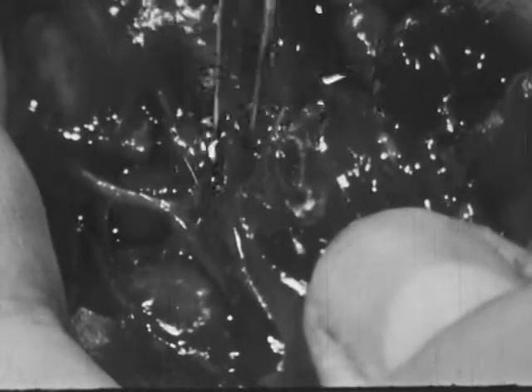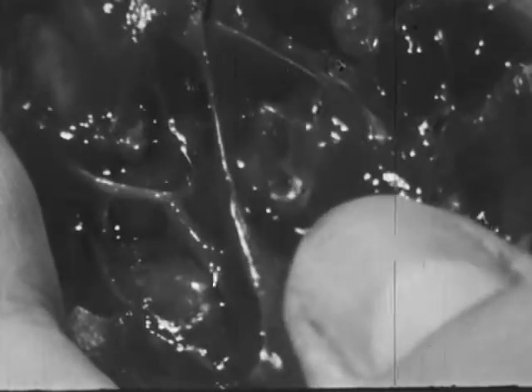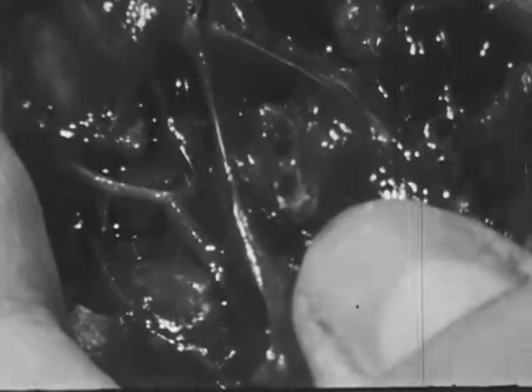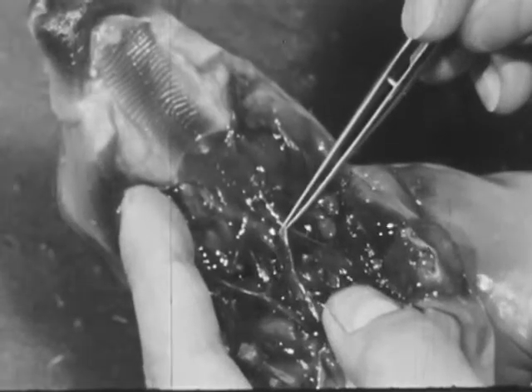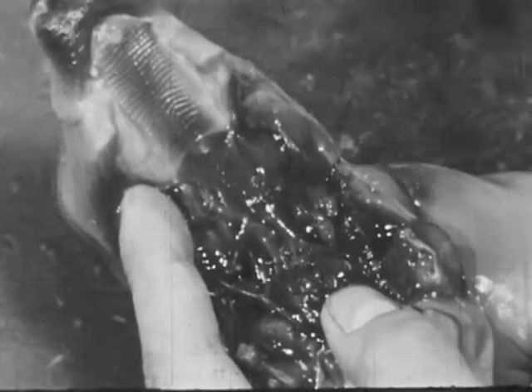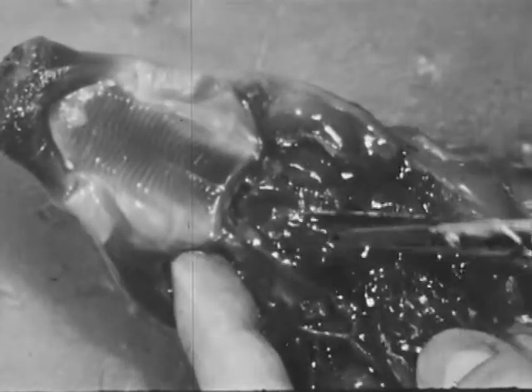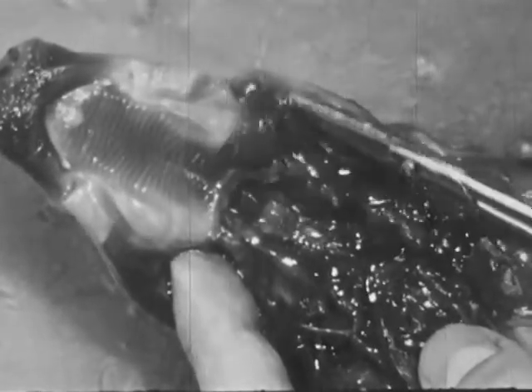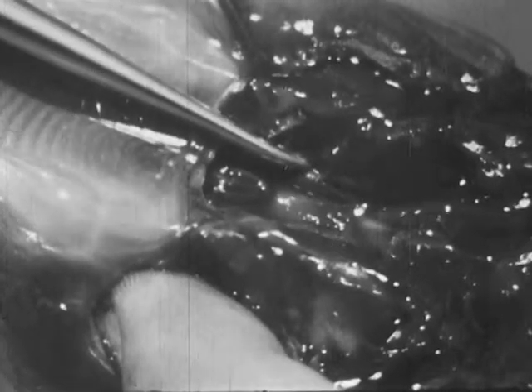Behind the glottis is the opening to the esophagus. Removing the soft palate shows the two openings of the eustachian tubes. Each tube connects the throat to a middle ear.